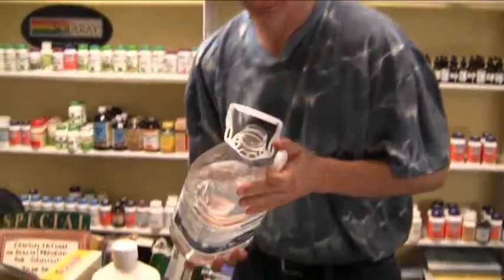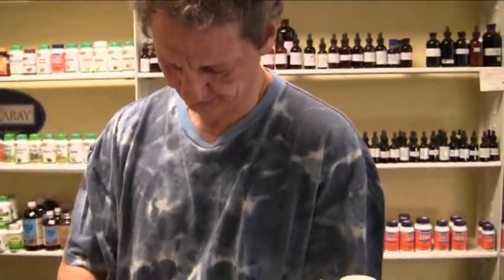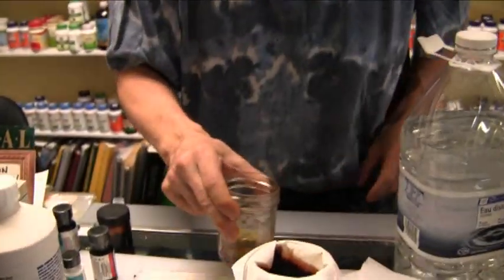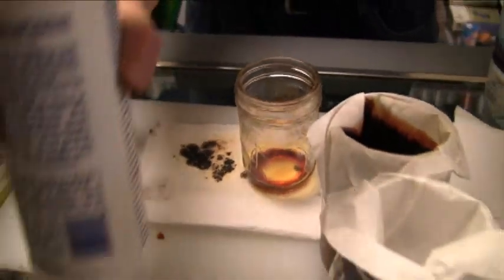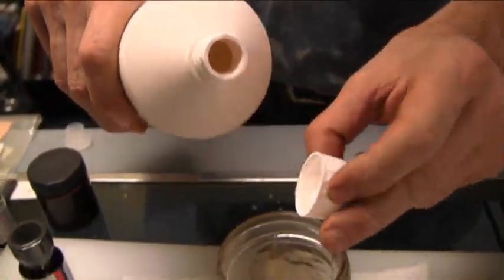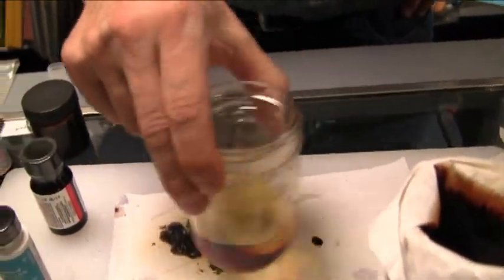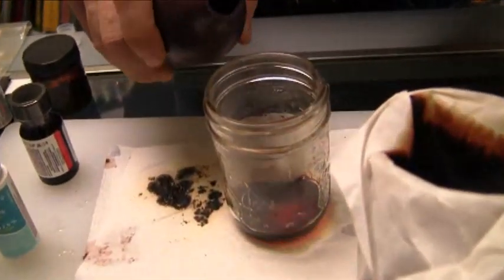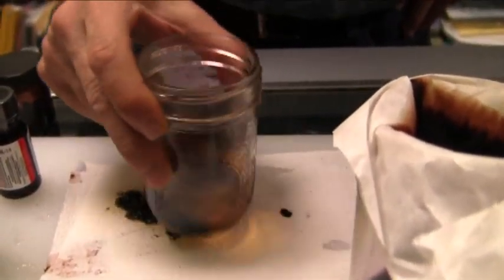Add less water this time. Swirl it around. There we go. Do you need the hydrogen peroxide? Not yet — you've got to dissolve and dilute it first. Add a little bit of acid. It may have been too much before. There is some crystal in that first one, but not a lot — it should have got a lot more. Add the muriatic acid, swirl it around. Okay, so that's dissolved. Now we add the peroxide. There we go — there's a purple. Crystals are forming.